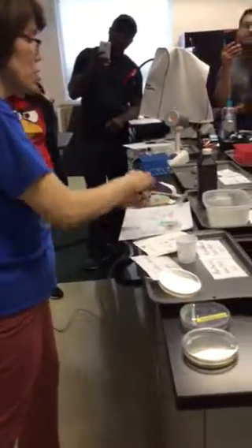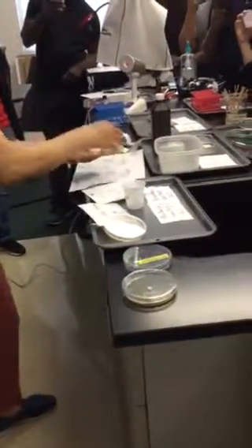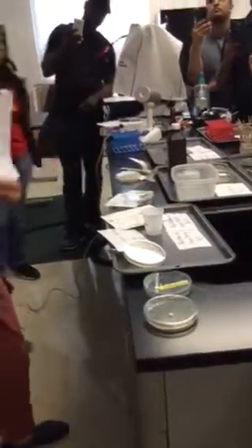Now for the bacitracin, we're going to do the same inoculation. We're just going to be using a different drug. This is bacitracin. Bacitracin also comes like this, just like novobiocin. I don't have the actual result with me, but let me just say, if you take a look at the flow chart, pyogenes is going to be sensitive. Enterococcus faecalis is going to be resistant. And we also have a reference number for you to compare with.